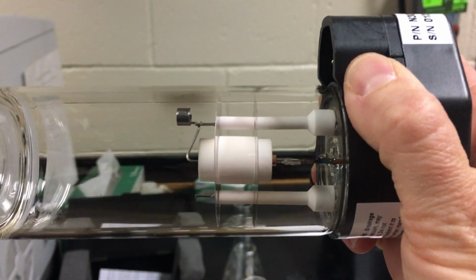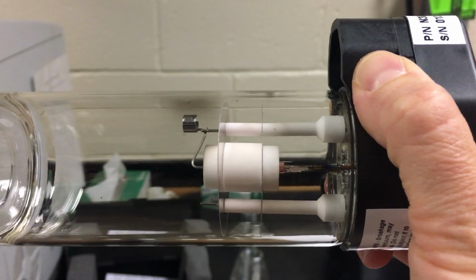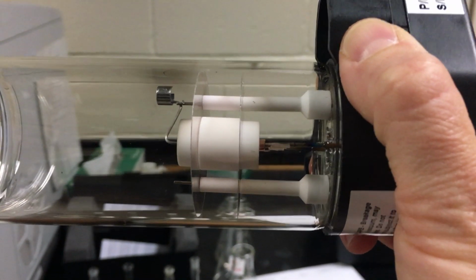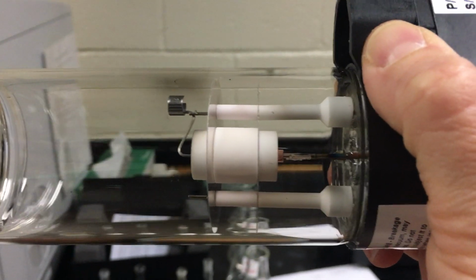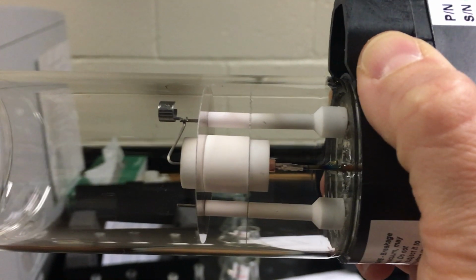Typically we see that this is argon. The argon gas then becomes ionized and starts to move about rather energetically through the hollow cathode lamp. That movement eventually causes argon ions to strike the cathode, which is made up of our metal of interest.